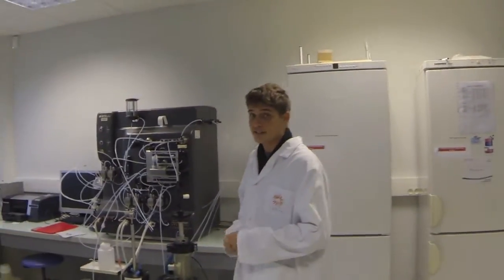After weeks or months of development, the whole process is ready in laboratory and just allows to purify a few micrograms of product. But it has to be adapted to get kilograms at industrial scale. And yes, here, the size matters.